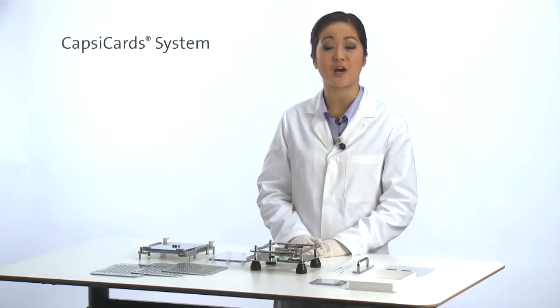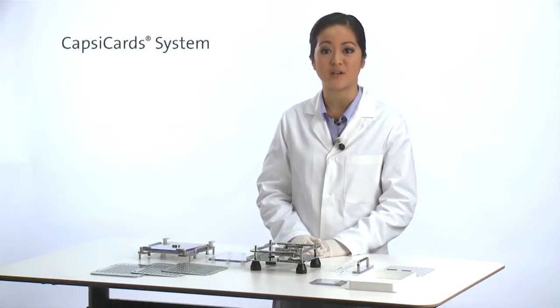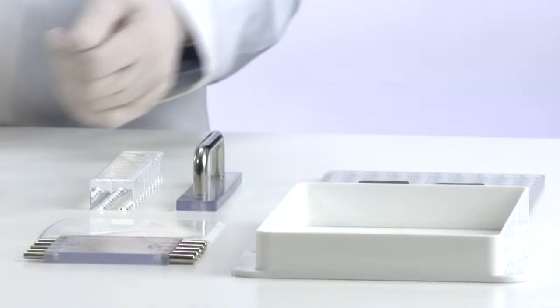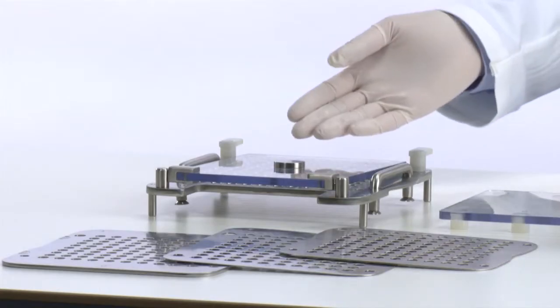The CapsiCards machine is available in 100 hole and 120 hole. A full CapsiCards machine for one capsule size consists of a filler base kit and a kit with filler change part.